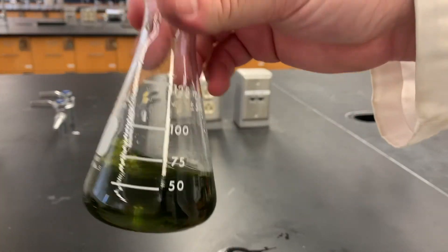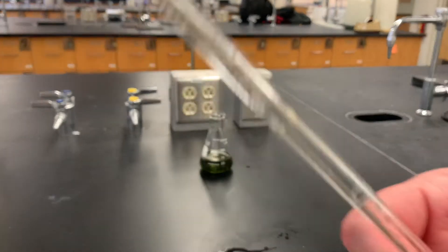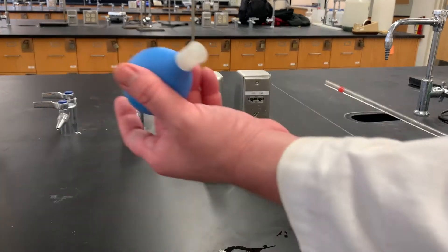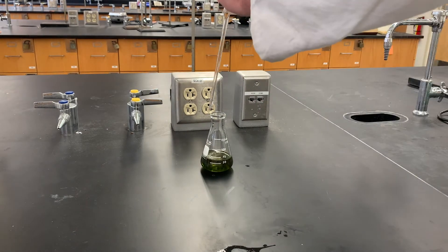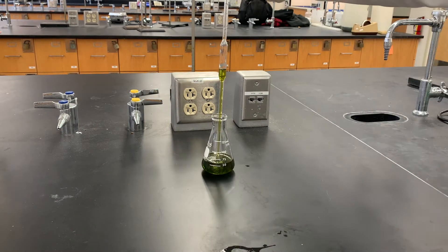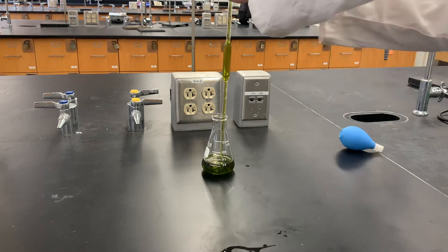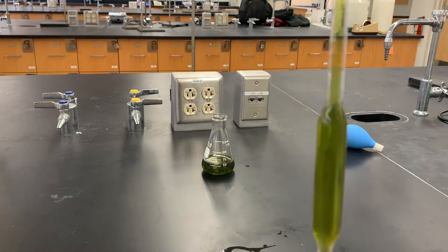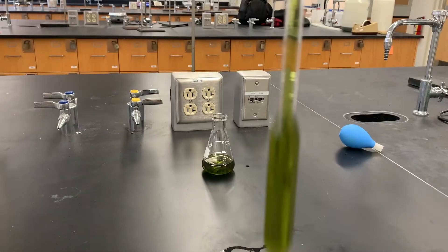So we're going to need to take our indicator. We're going to get a 10 mL pipette. And as always, press on the pipette bulb, evacuate the air, suck up the amount that you need — a little bit too much — let it come down a bit, put your finger on it, lower it to the right point, and then add that in.